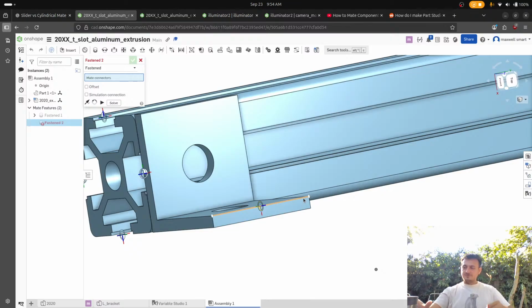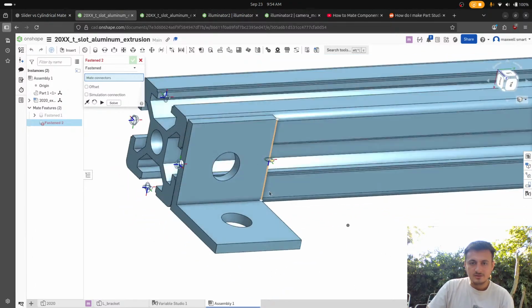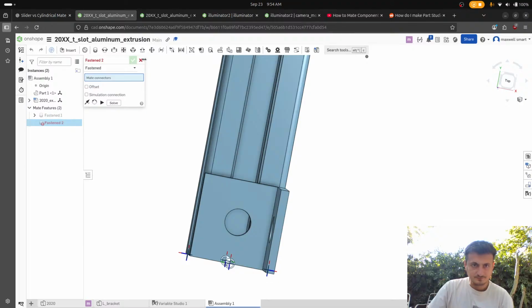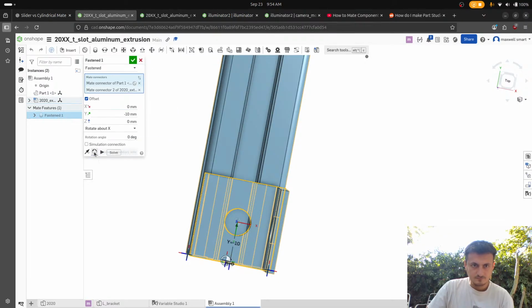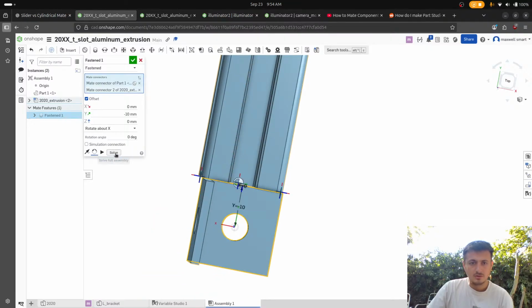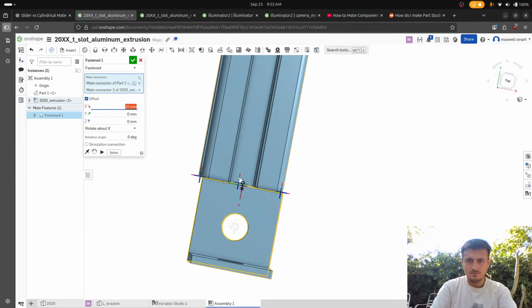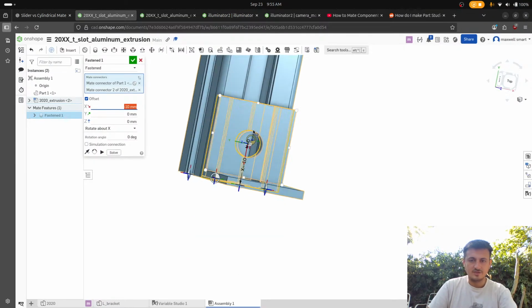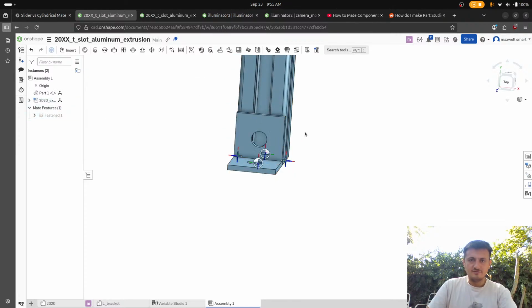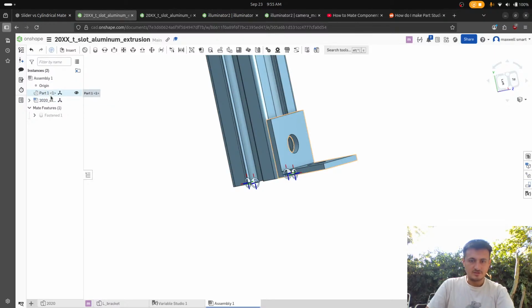I'm realizing now that my design will be bad, but right now we're sort of doing exploratory CAD. Oh, interesting. Oh, I see. Okay, wait. So if I did what? Bro, I really messed up those mate connectors. Okay, so this is kind of what I was thinking. And then we insert this part again. Let's rename this thing.